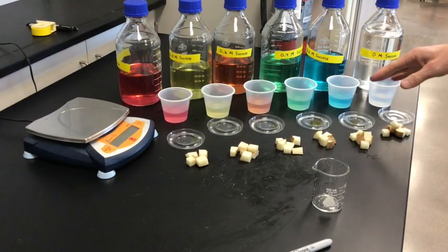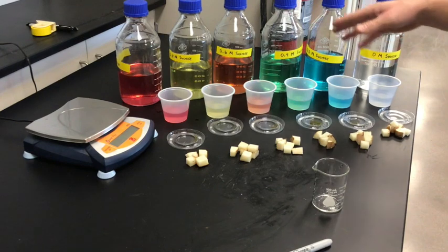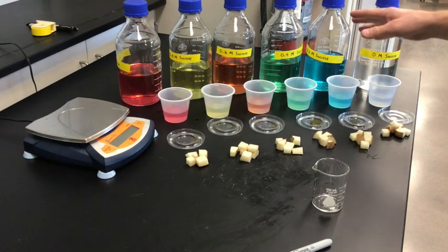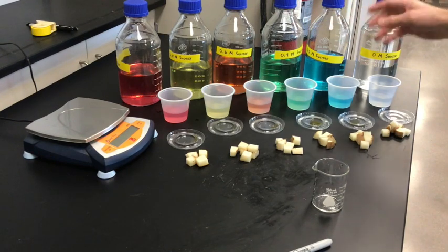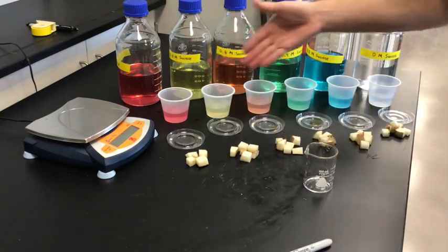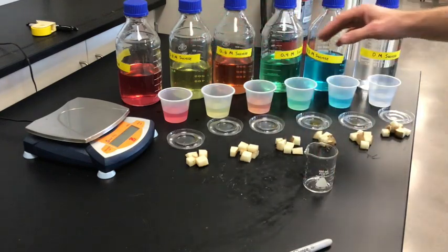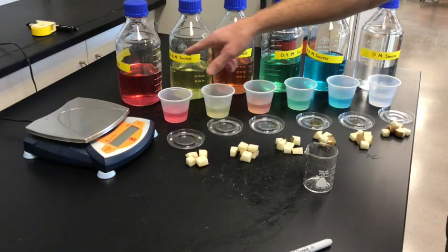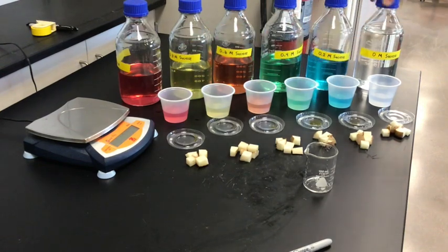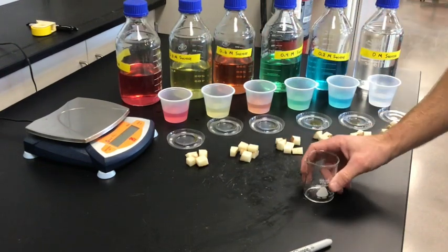I should mention that the food coloring I put in here is not going to affect the experiment. I used the same beaker each time going from 1.0 to 0.8 to 0.6 to 0.4 to 0.2 to 0, but that shouldn't be a big deal.